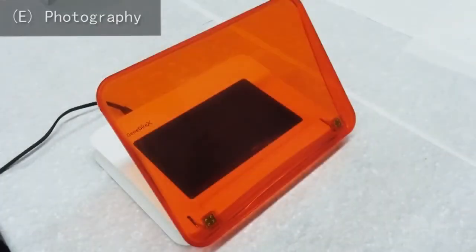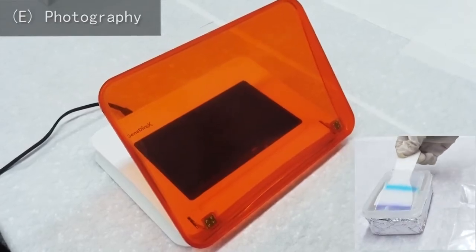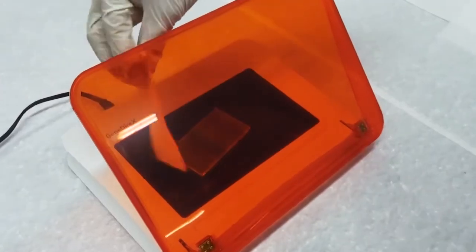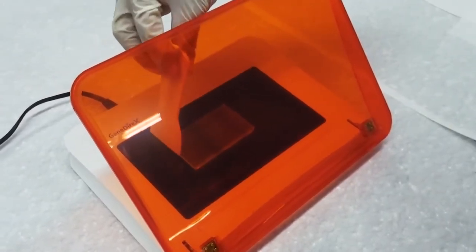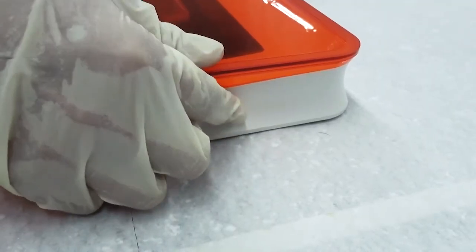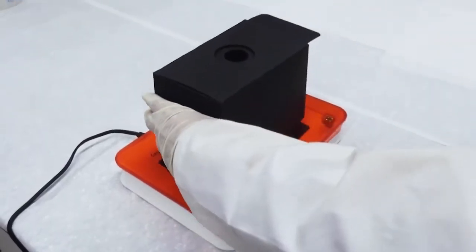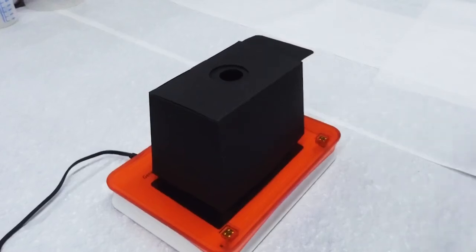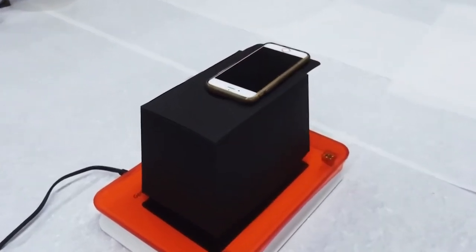Use the blue view imaging system. Wearing gloves, gently prop up the gel with a spatula. Drain the excess buffer and transfer the gel onto the gel visualizing box. Close the lid and turn on the blue light to stimulate the dye. Caution, do not look directly at the blue light. Use a camera to photograph the gel.